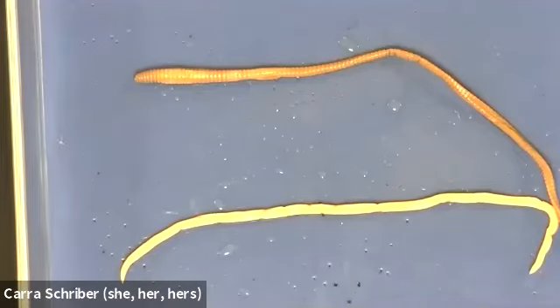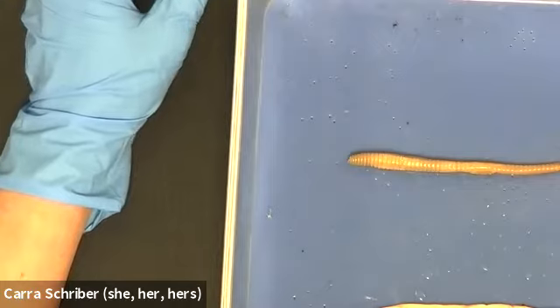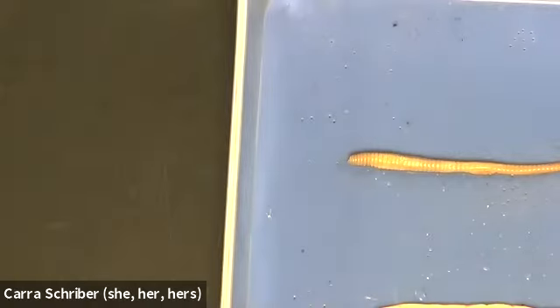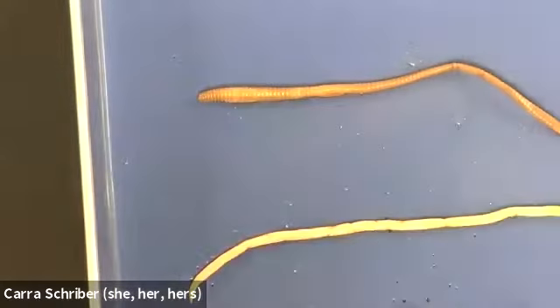All right, hi folks. So part 2 of Animals 1. In the first part we were looking at different subgroups of Animals 1. We looked at some sponges, some cnidarians, flatworms, segmented worms, roundworms, and then also some arthropods. I wanted to follow up by doing a dissection of 2 different worms. So we're going to look at a segmented worm and also a roundworm.